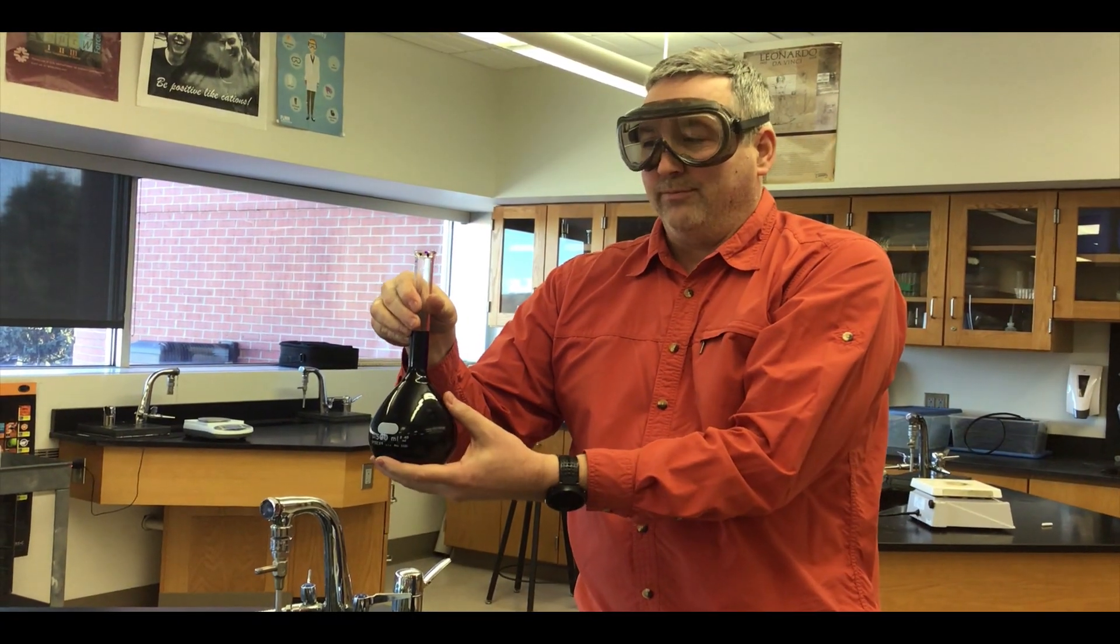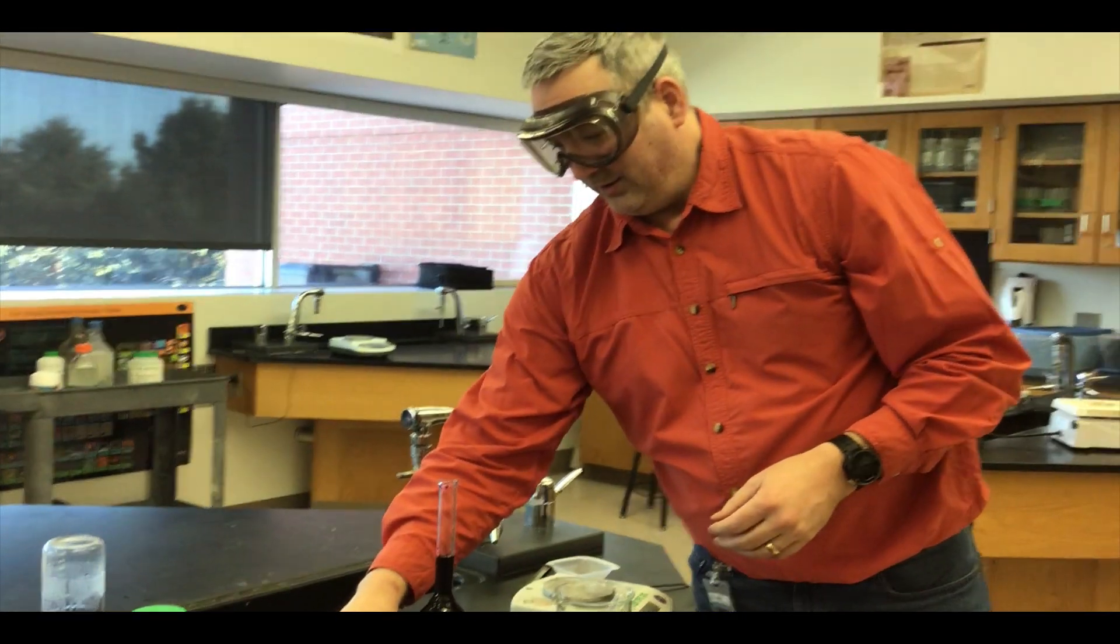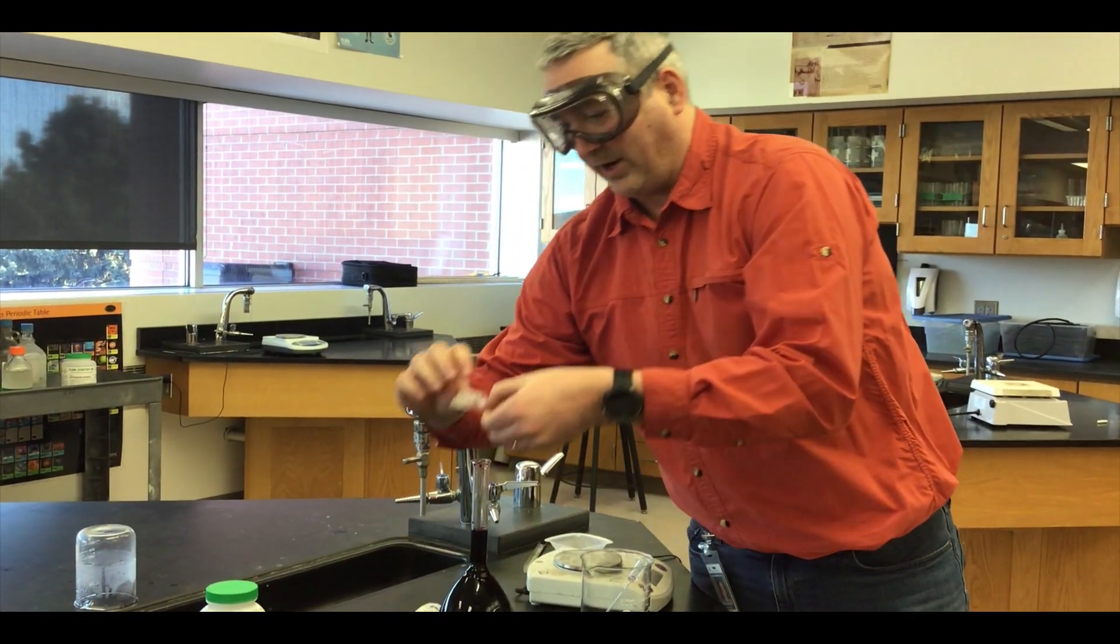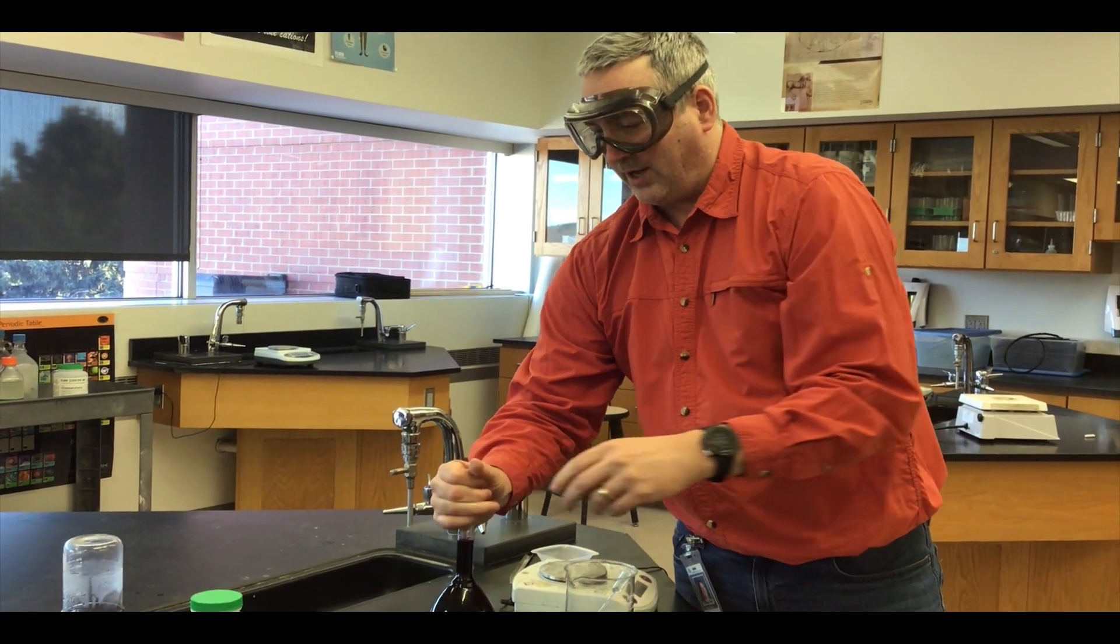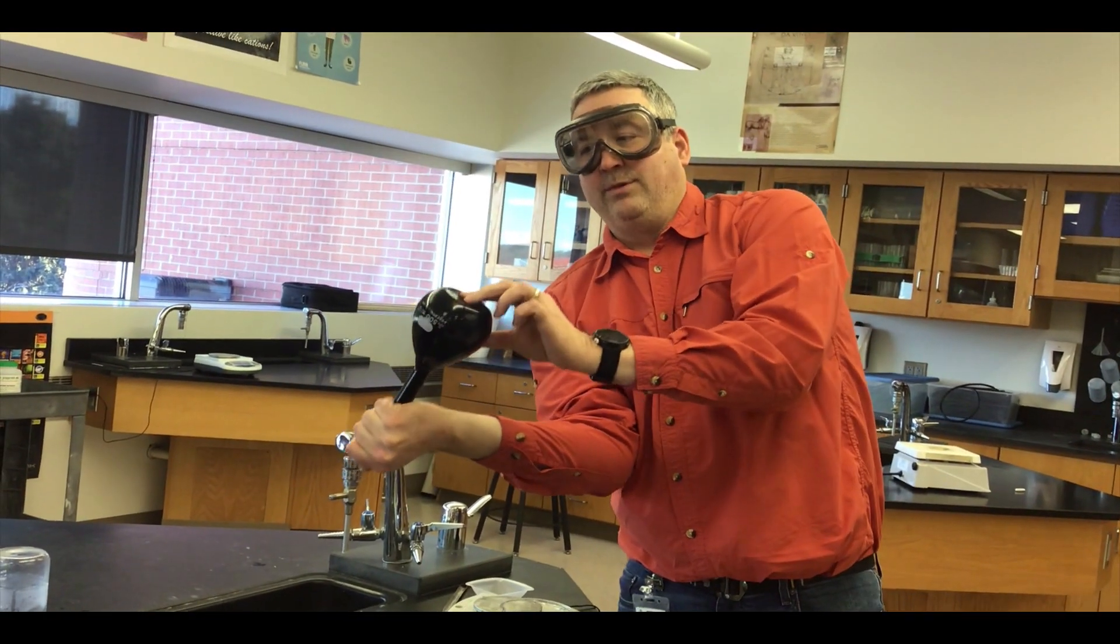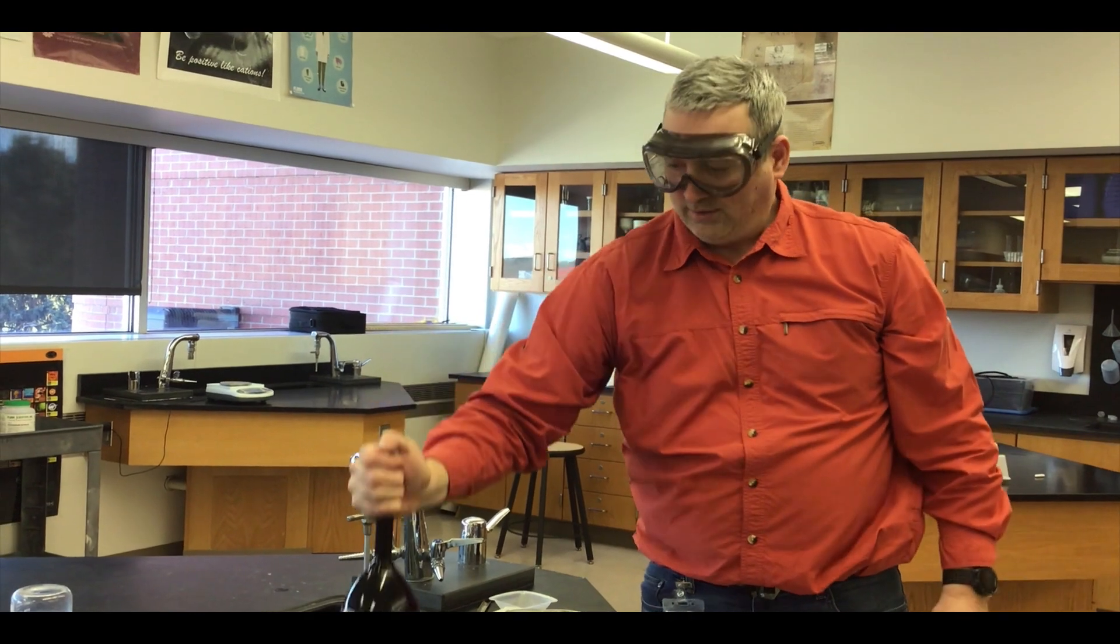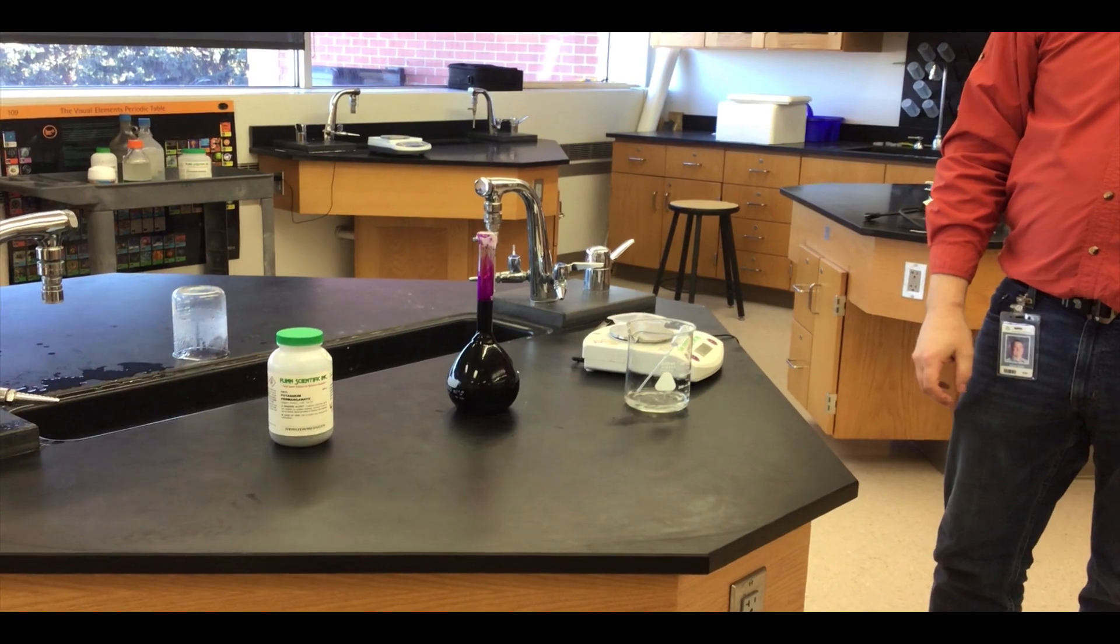So we also want to, well not eventually, but our concentration is going to be more in the bottom than the top a little bit since we just added the water. So now we want to flip it a couple times after sealing the top. And now the concentration is consistent throughout. So we always want to bring it up to the correct volume, not start with the volume that we want, and that's really the key.